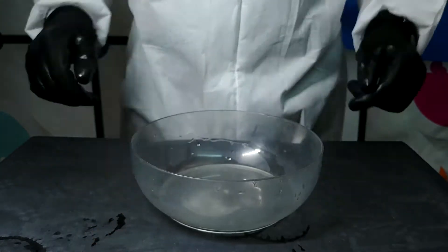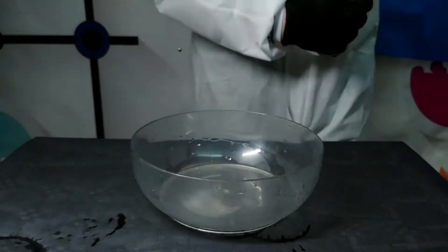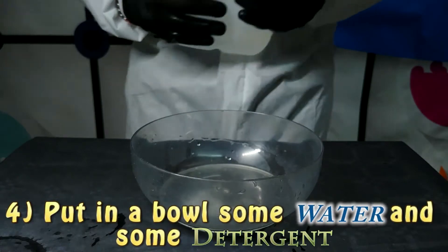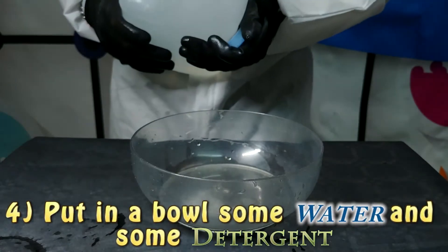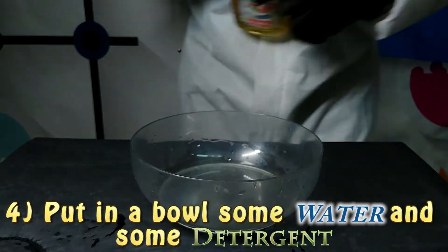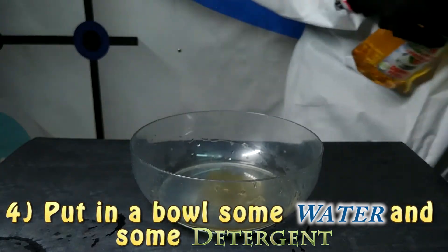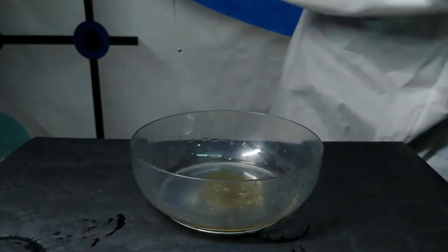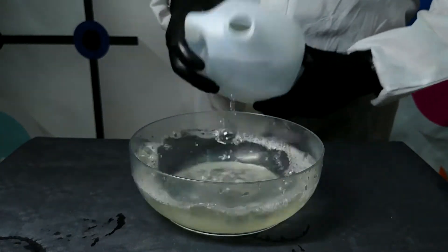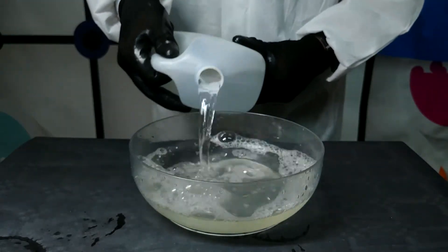To do so we are going to use a flexible tube which is going to be connected to this conical flask. The next step is to take a final recipient in which we are going to pour some water and then also some dish detergent.